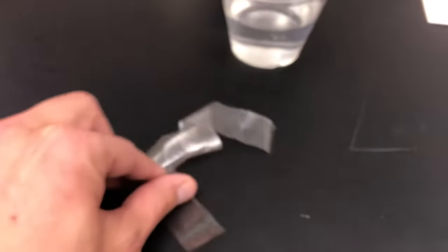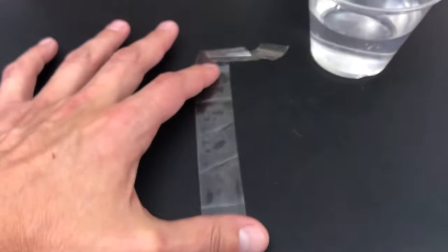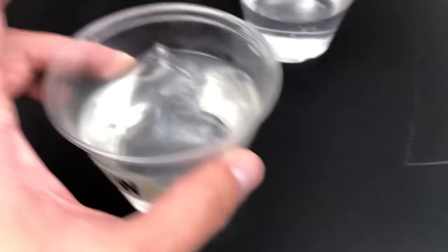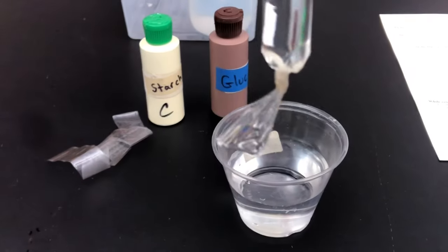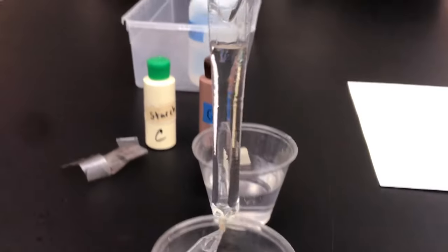I'm going to do a demonstration of our dialysis lab activity, and this right here is a dialysis tube. It kind of just looks like a piece of flat plastic, but what I've already done is soaked another piece in water. If you rub your fingers while it's soaked in water, it actually is a tube. I tied a knot in the bottom, added some water, and you can see it's inflated — it really is a tube.